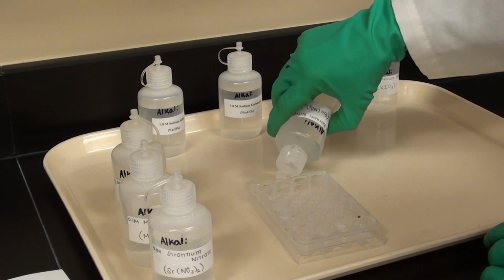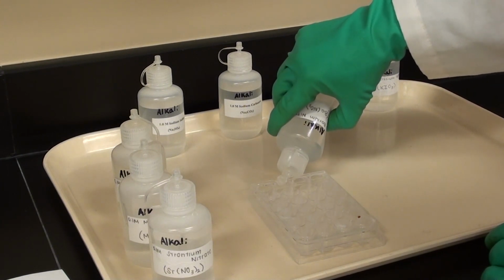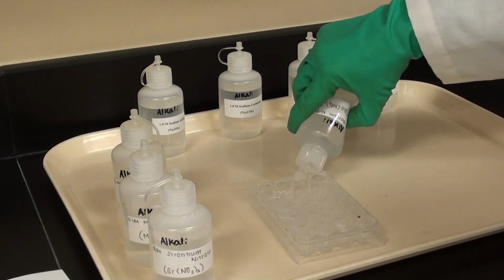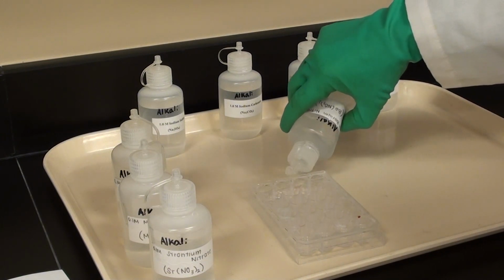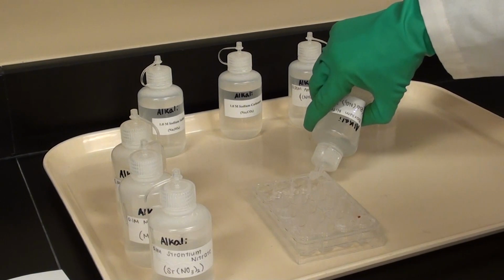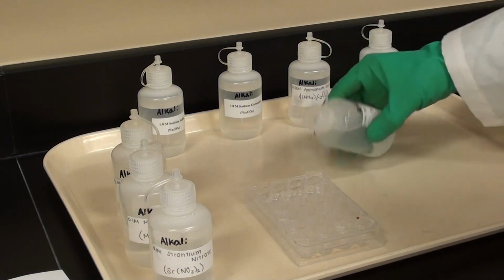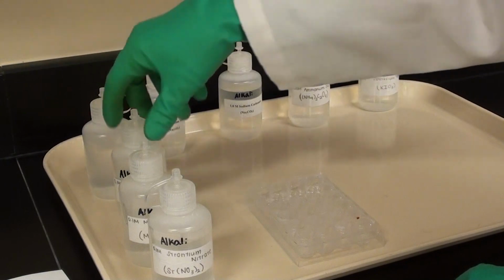Now when you're working in the lab, depending on how the lab is laid out, you might want to let other groups have access to the bottles. Don't all run up to the hood or the station to do this, because this takes a little bit of time. We don't want any bottlenecks. You could be doing the other part of the lab at the same time as other people are doing this part too. When I teach this class, I have half the class do part B, while the other half does part A. I think that's smart.